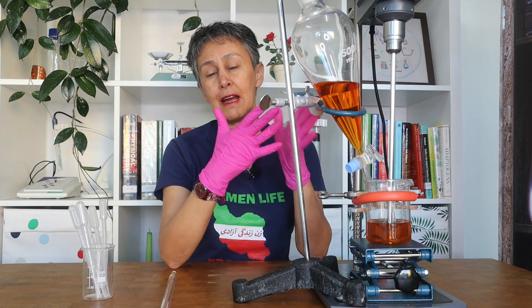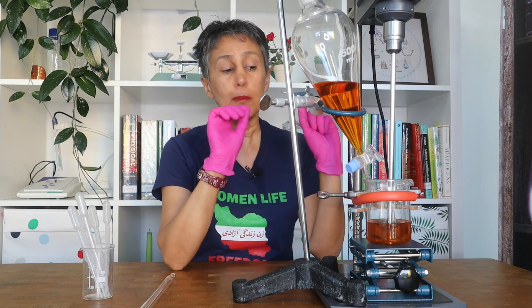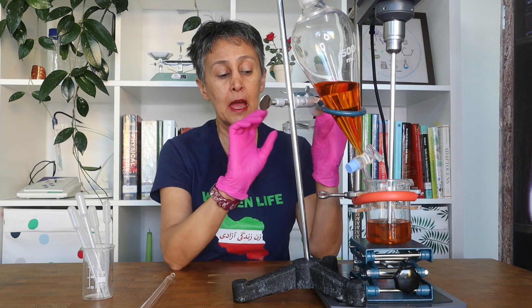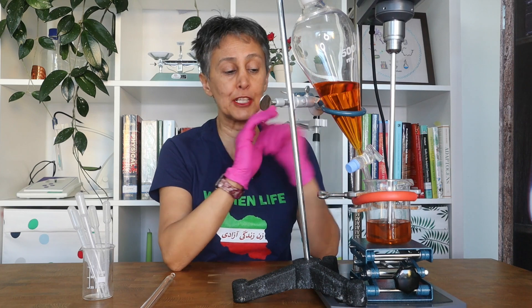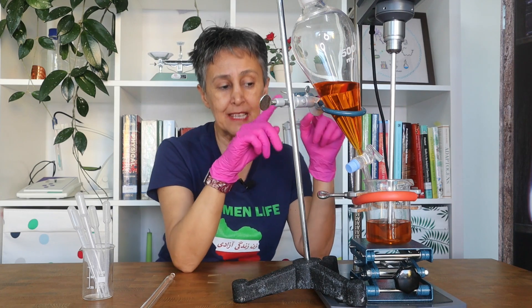It's much easier and faster than using a pipette, and it works perfectly for small batches up to two kilograms. It will certainly work up to five kilograms — perhaps even more — you just need to do some modifications and adjustments. I'm using here a kind of dropping funnel or separating funnel.